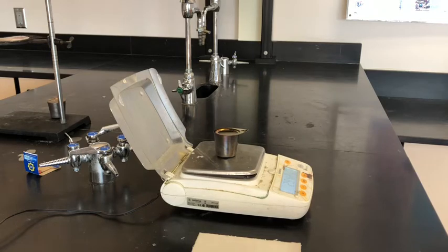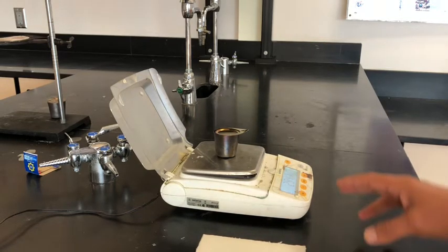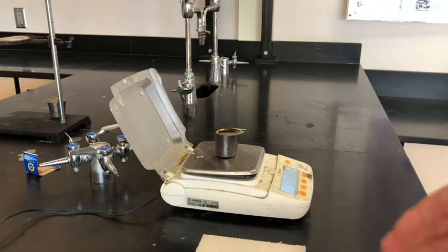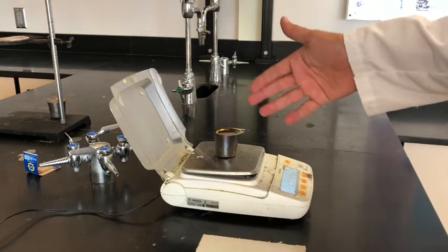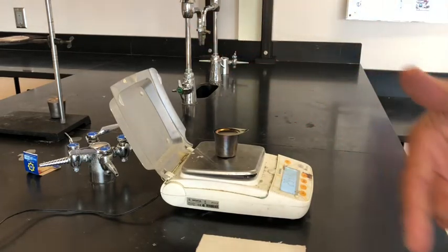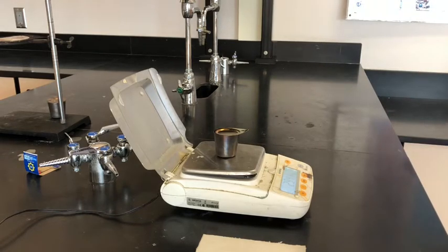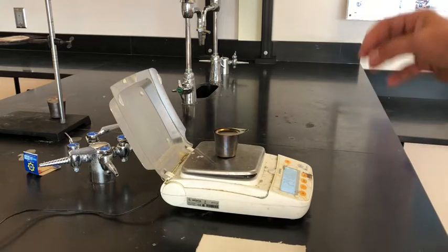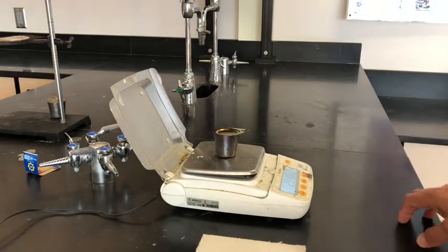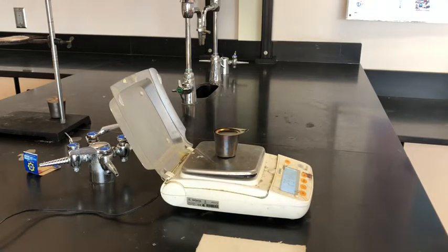The reason that we wanted to do that is because we wanted to make sure that the sodium bicarbonate had completely decomposed the first time. So we heated it for 2 minutes, took the mass, heated it for a second 2 minutes, which you didn't see in the video, and this is now the second time we're taking the mass. And it is within 0.02 of a gram from our first measurement, so we're gonna call it good.